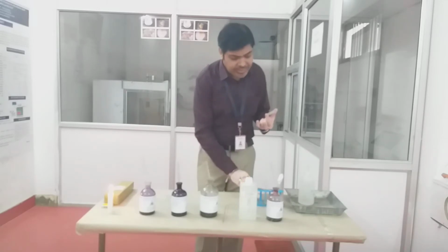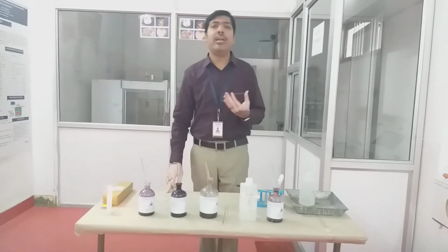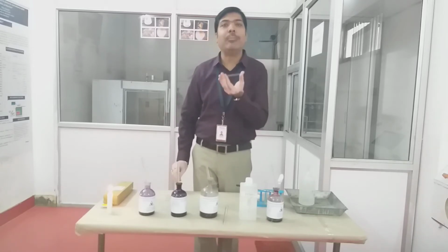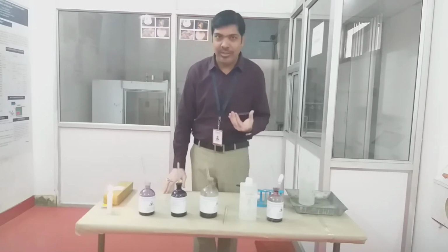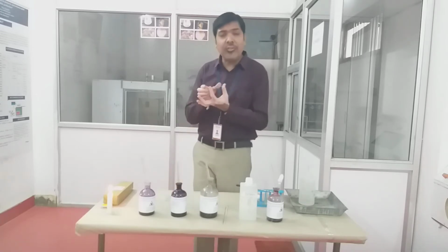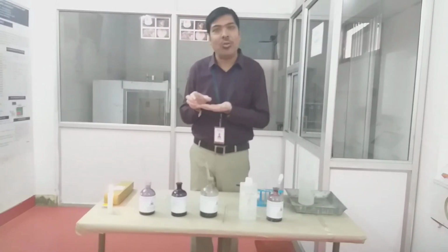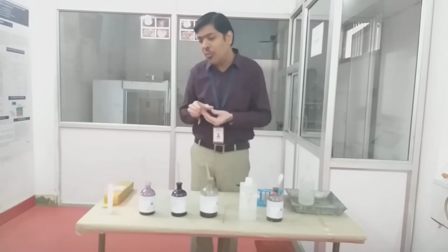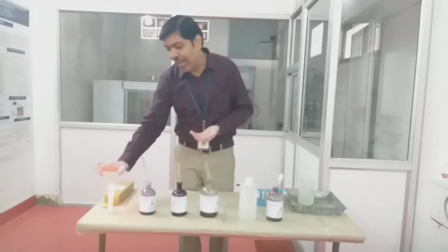This step is called the formation of the smear. We have already seen in the theory also that in many experiments we have to first go for the preparation of the smear. So a thin sample of the microorganism is applied on the surface of the slide in order to form a smear. Then we have to go for the air drying of the smear. After the air drying, we have to go for the heat fixation of these microorganisms on the surface of the slide. For the heat fixation, we have to repeatedly pass this slide over the surface of the flame like this way.